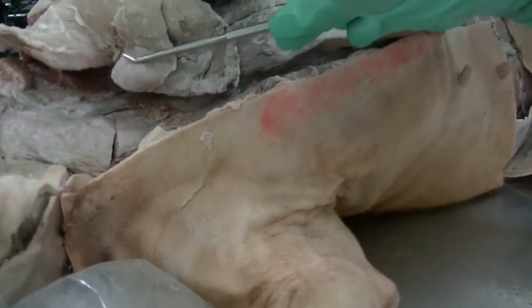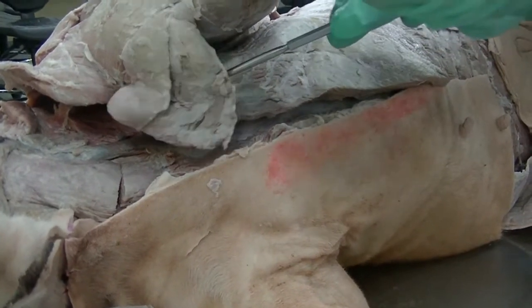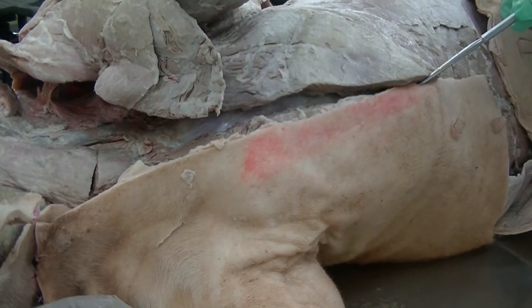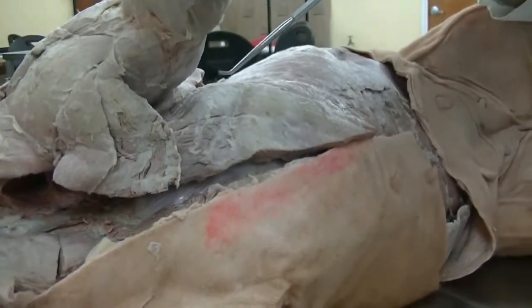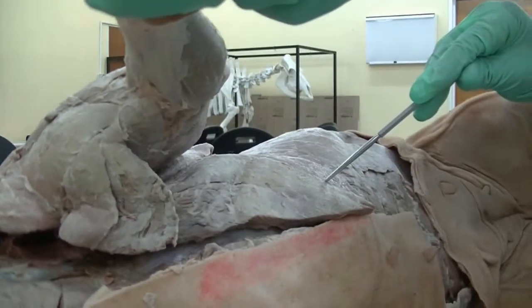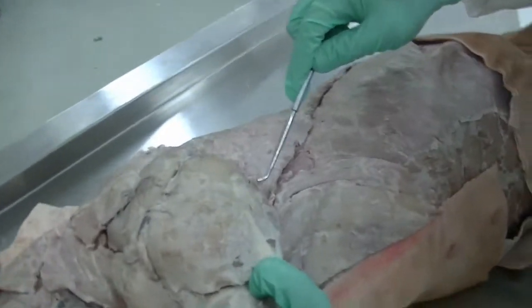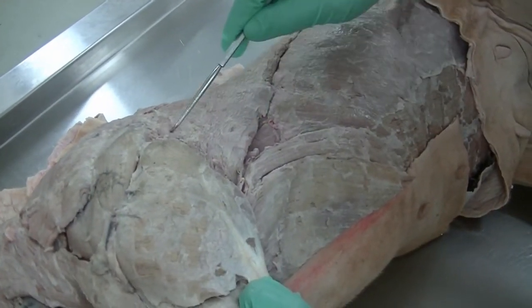We can see the transected pectoral muscles, the descending pectoral, the transverse pectoral. Combinedly, we call them superficial pectoral, and we have the deep pectoral, which has also been transected from its attachment from the sternum. All of that bulk is part of the deep pectoral, which can be seen here. Again, we come back to the latissimus dorsi with part of the cutaneous trunci still attached to the muscle.